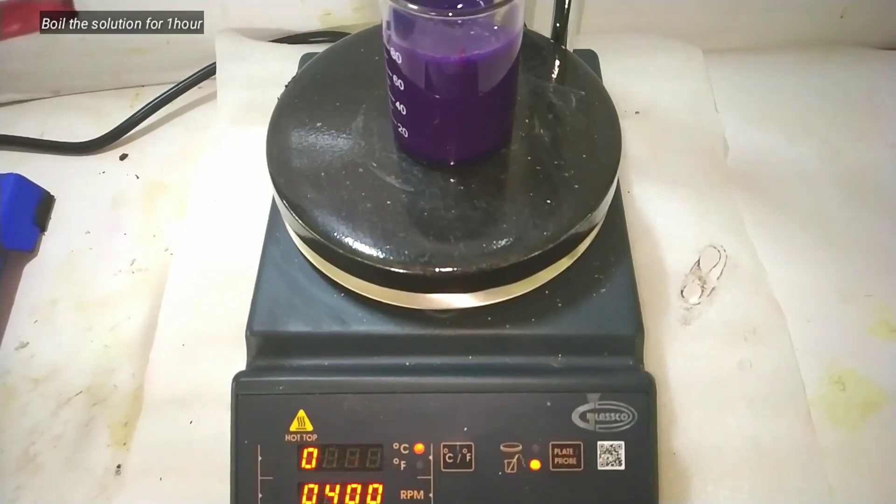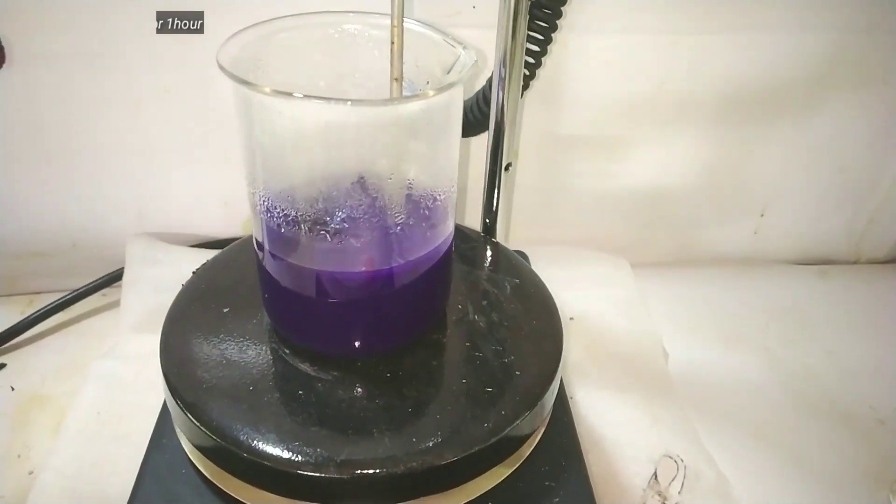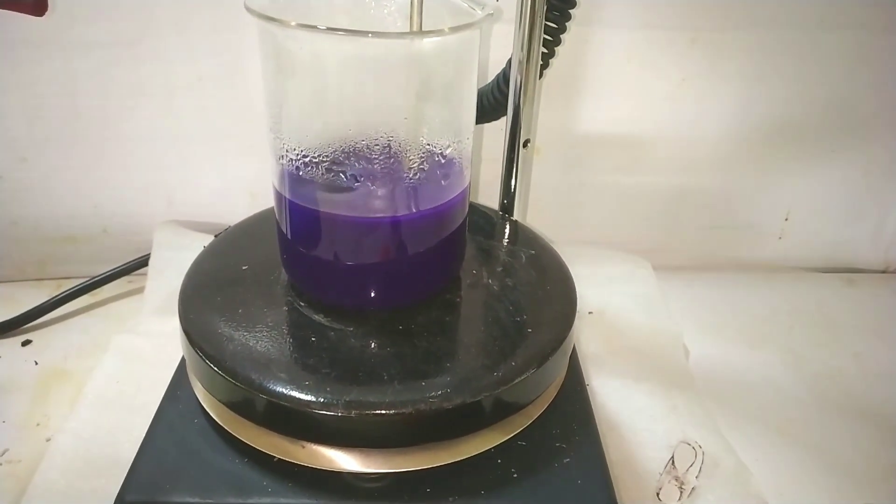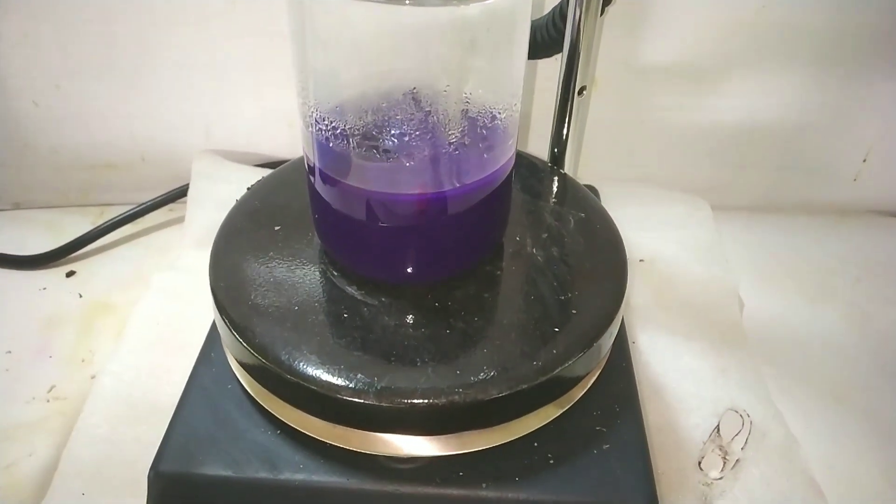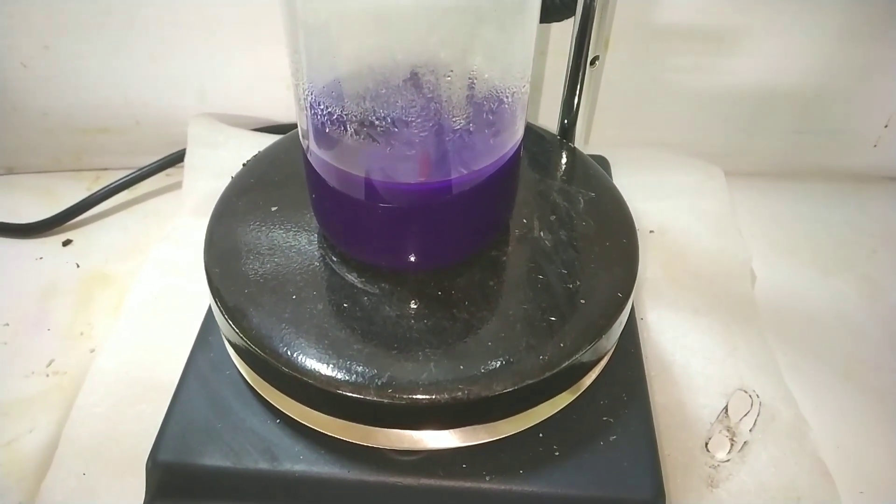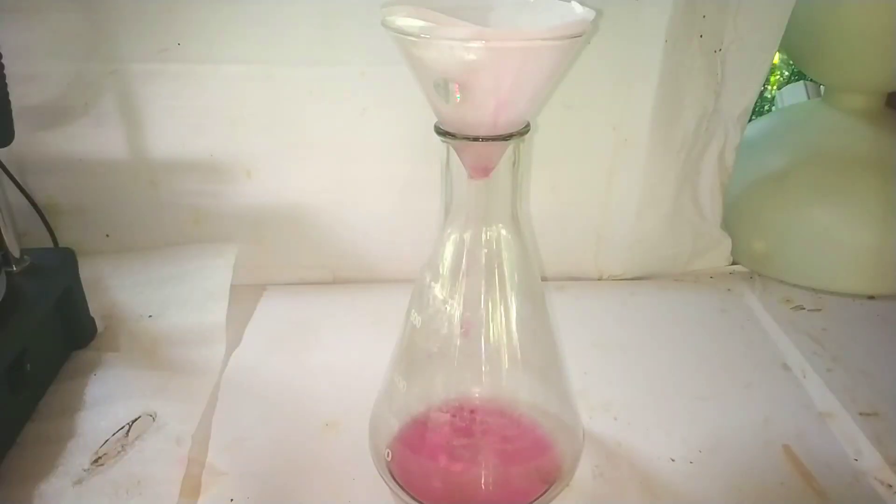Which is why I first heat this beaker to boil. Since the 100ml beaker is already full, I have transferred everything into a 250ml beaker and I added more water and made it around 200ml.